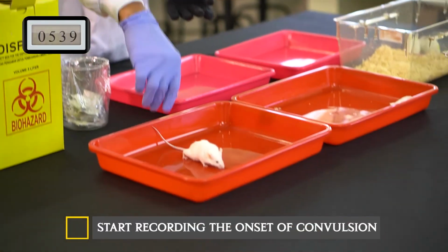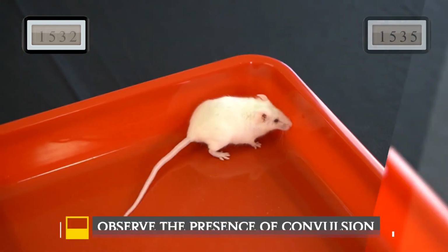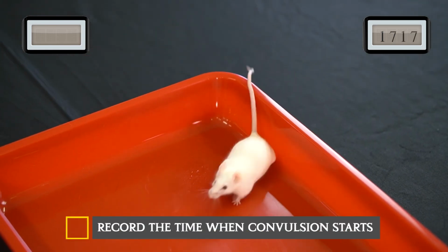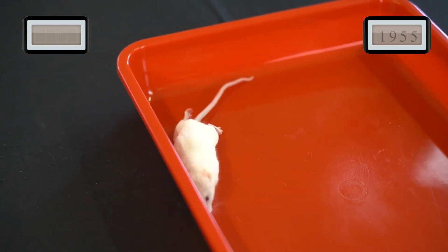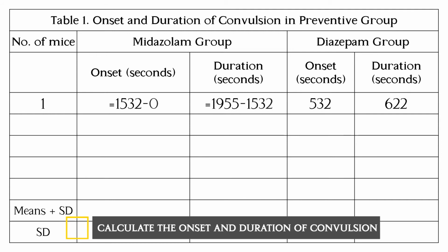Turn on the stopwatch to start recording the onset of convulsion. Observe the presence of convulsion. Record the time when convulsion starts. Record the time when the convulsion stops. Observe and calculate the onset and duration of convulsion occurred in the midazolam group.